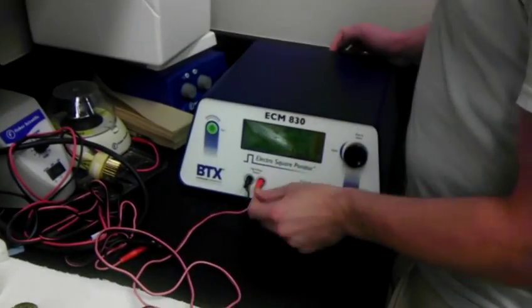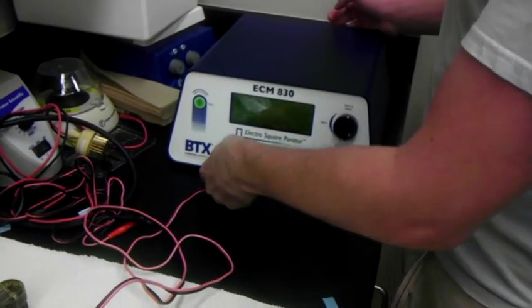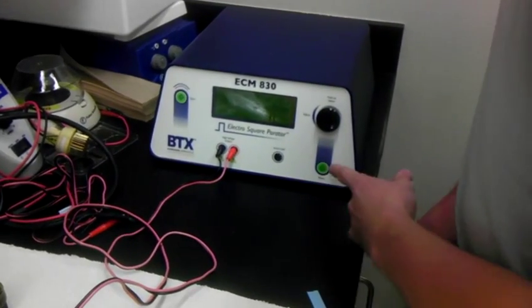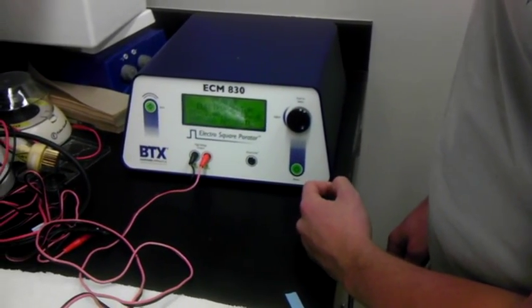Plug the electrode in, black to black, red to red. Very nice. Turn the switch on. Takes a second to warm up.